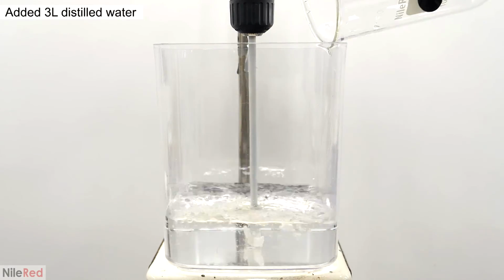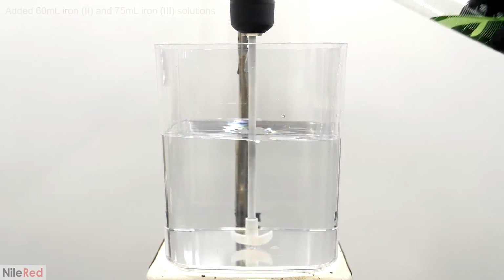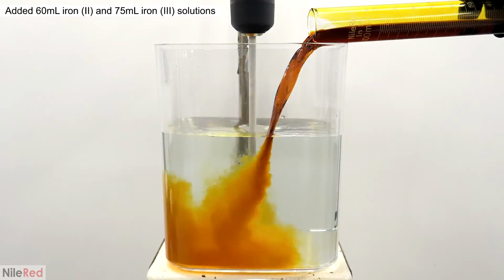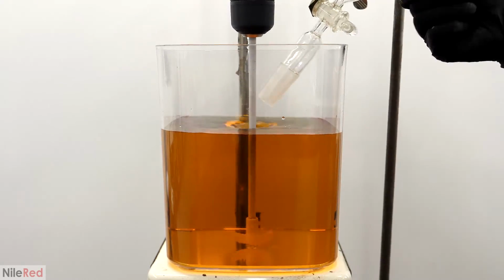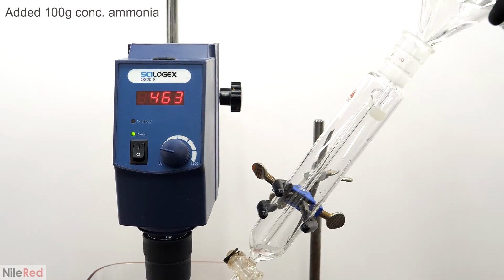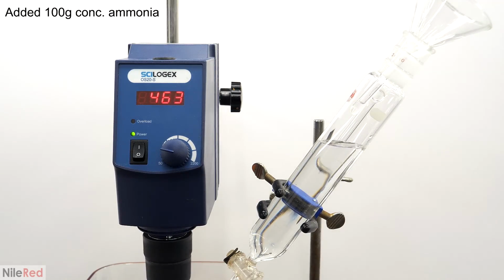Now to get things started, I filled up this container with about 3 liters of distilled water, and I turned on some weak stirring. Then I added 60 ml of the iron 2 solution, followed by 75 ml of the iron 3, and I let it stir for another 10 minutes. During this time, I set up an addition funnel, and I filled it with about 100 grams of the concentrated ammonia. Also, you can see here that at this point, the RPM of the mixer was at 463.